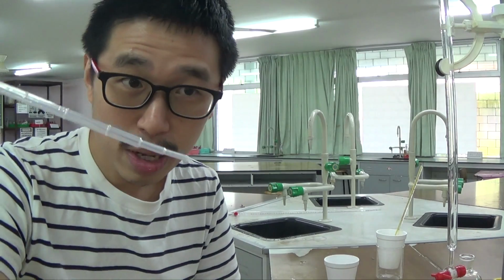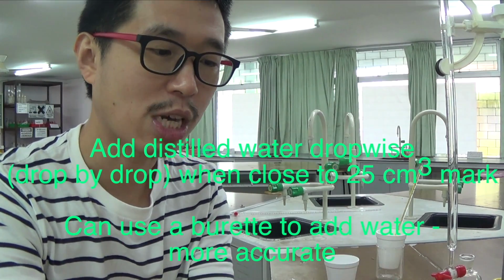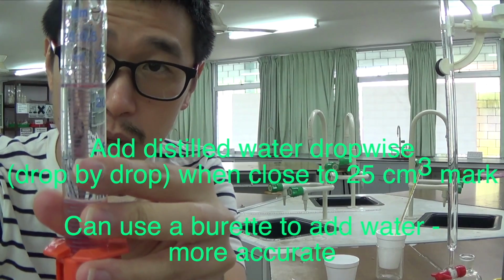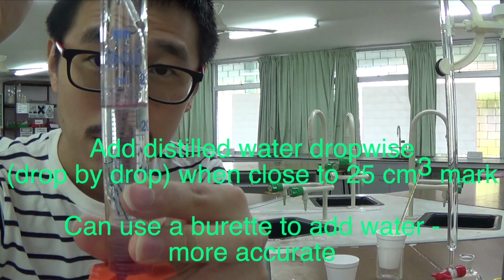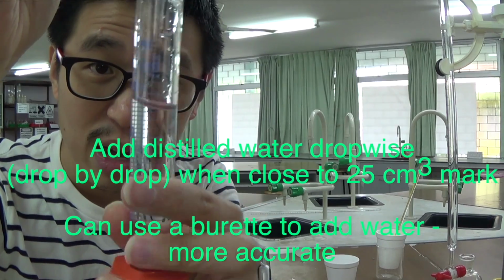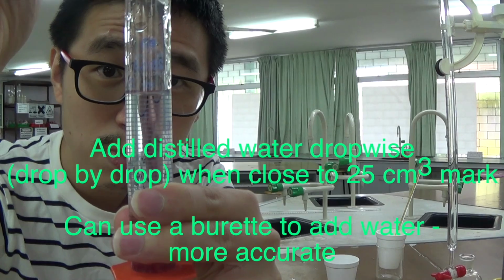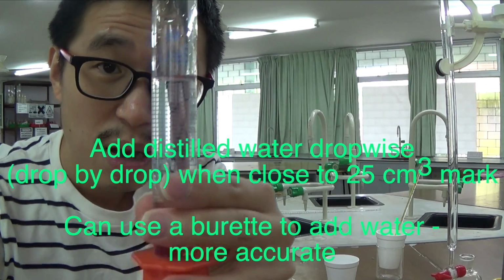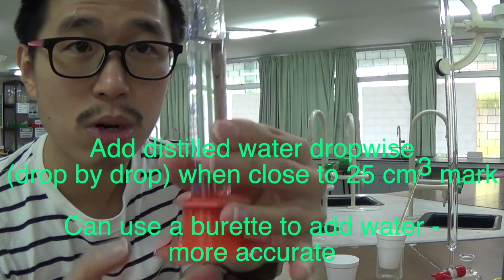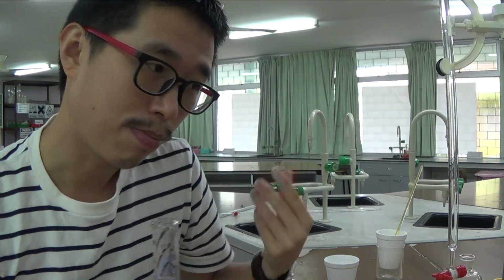You add drop by drop towards the end, just like you make up a stock solution, because you don't want to miss it. You need to get it as accurate as the measuring cylinder allows. The measuring cylinder is not the most accurate thing in the world, but at least you can get it to 25 ml, 25 cm³. That's the best you can do.